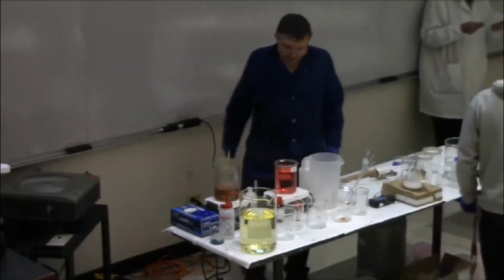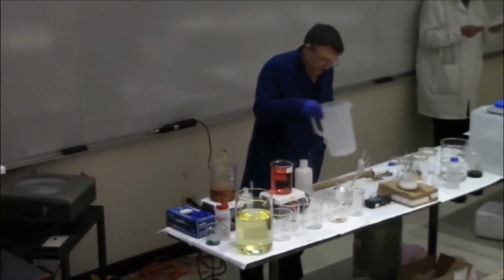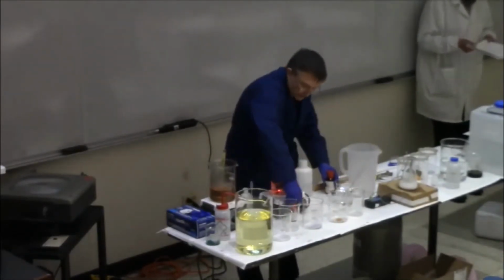Now, I'm going to do another experiment that is changing the colors.